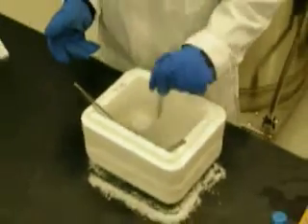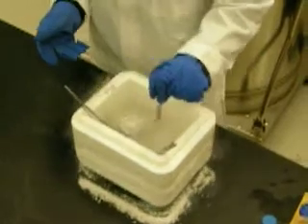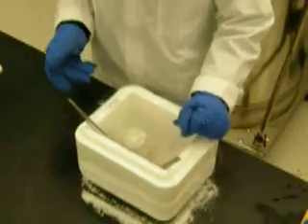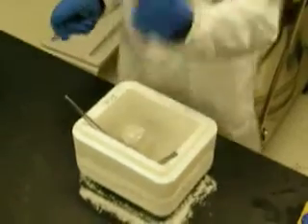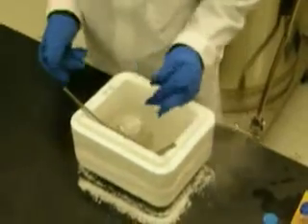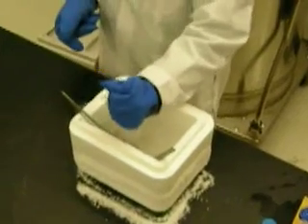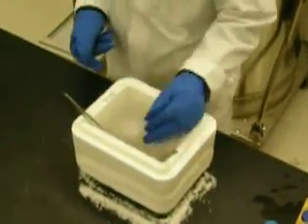This is the fun part, I get to be aggressive. Yes, this is the real technical part here. Where you have to get the quarter inch socket extension drive. Which actually I was thinking might be good just to crush them while they're still in there. Yeah, but you know what? You're letting that warm up.